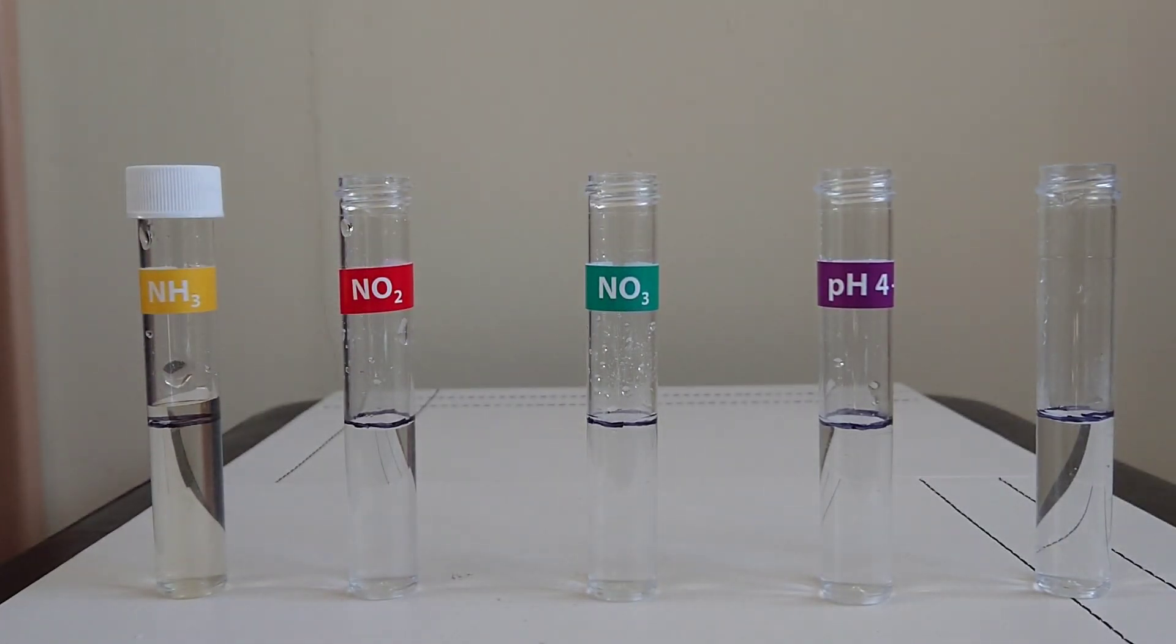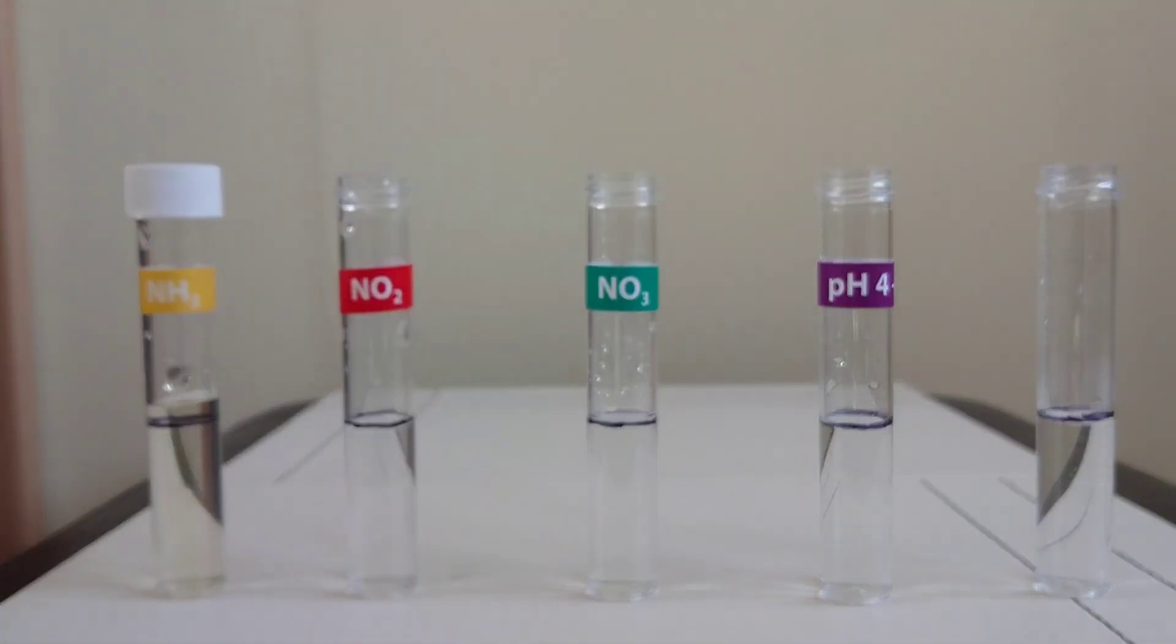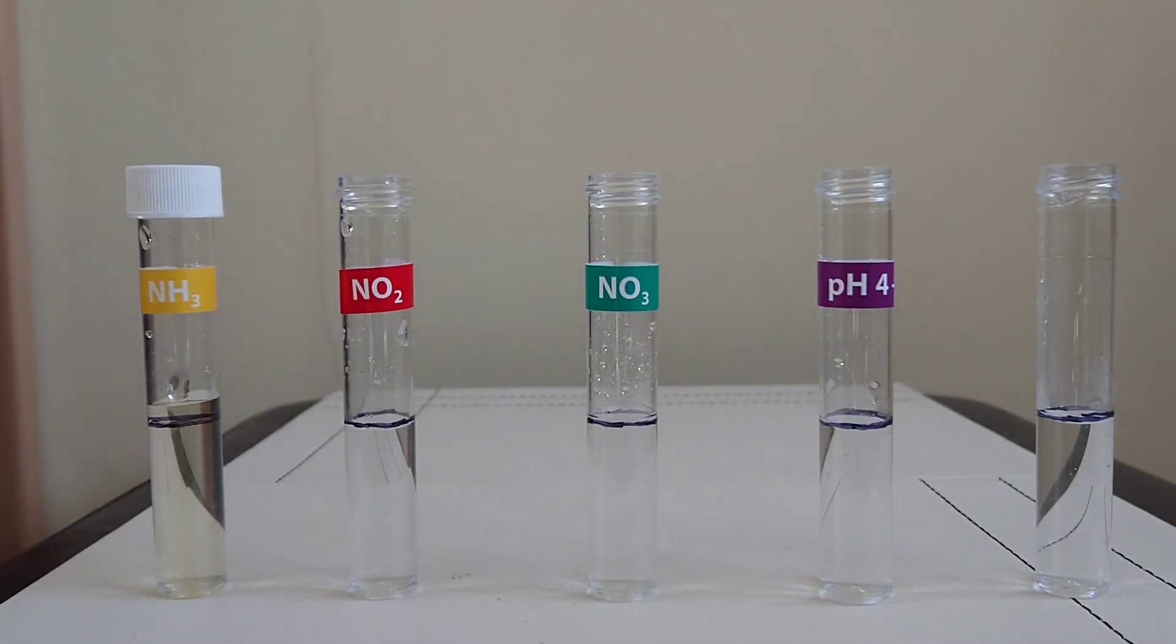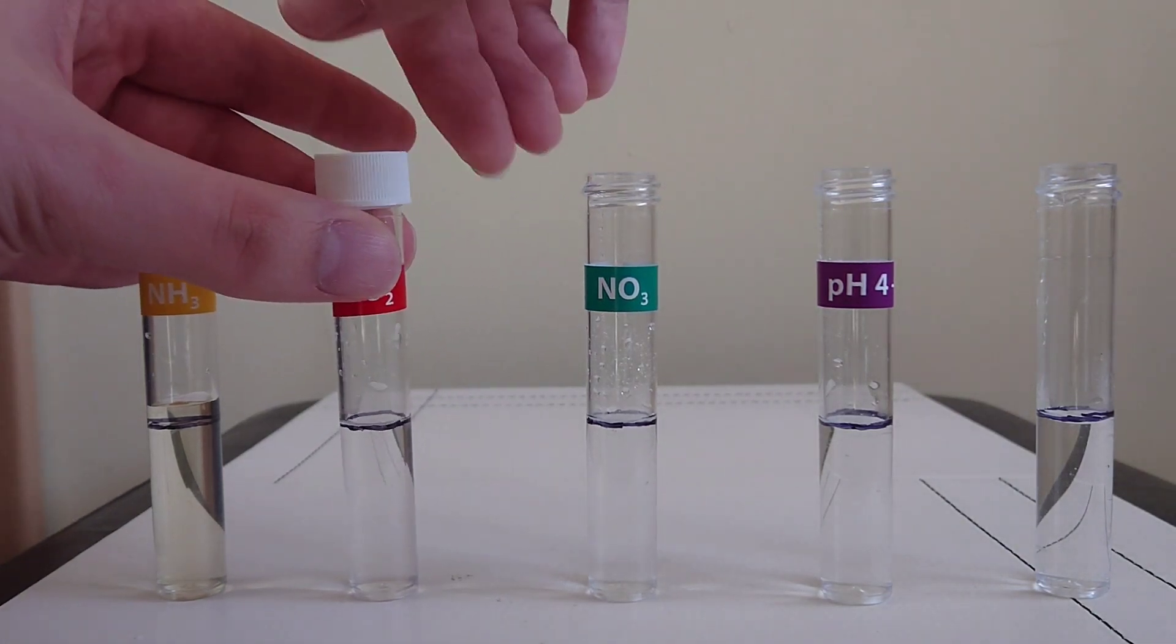Next up is the nitrite test. This one's just one bottle and you add five drops, and then that takes two minutes to develop. Adding the five drops, screw on the cap.